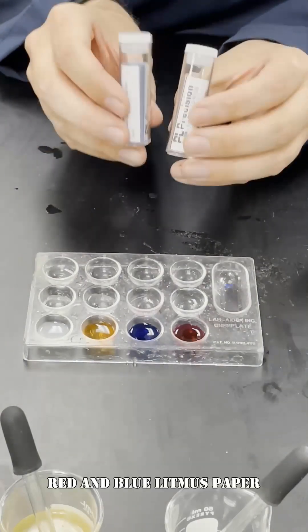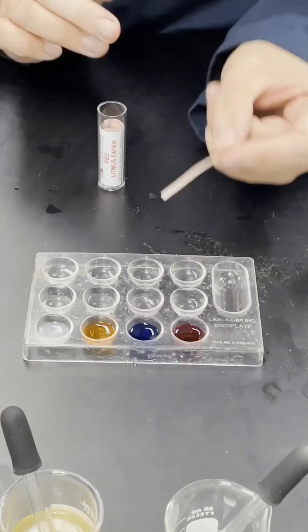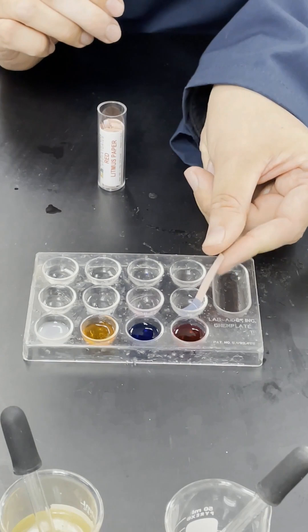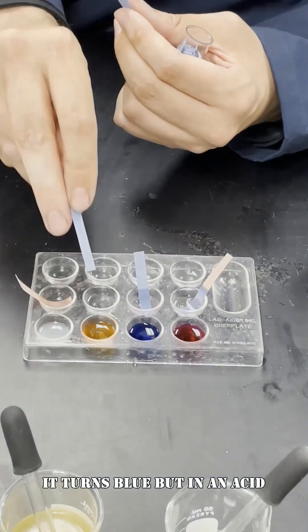Next, I have red and blue litmus paper. In a base, it turns blue. But in an acid, it turns red.